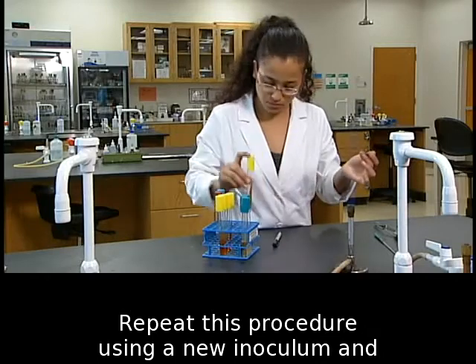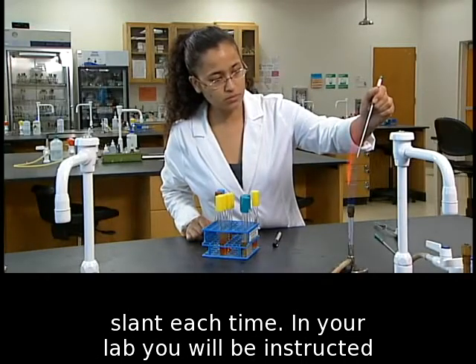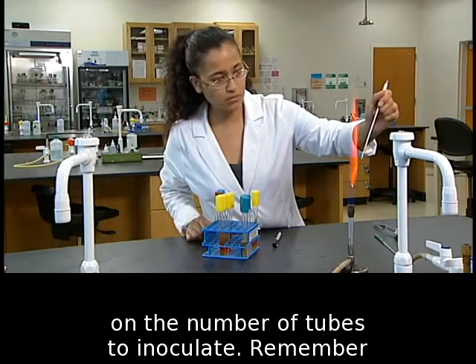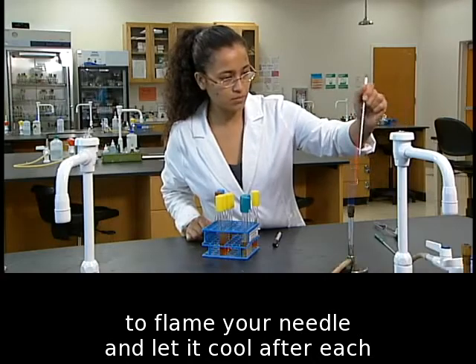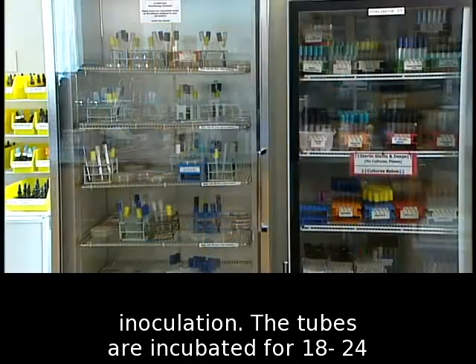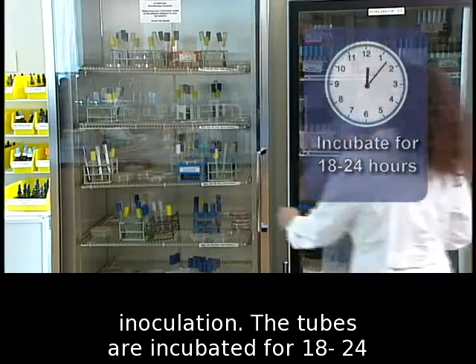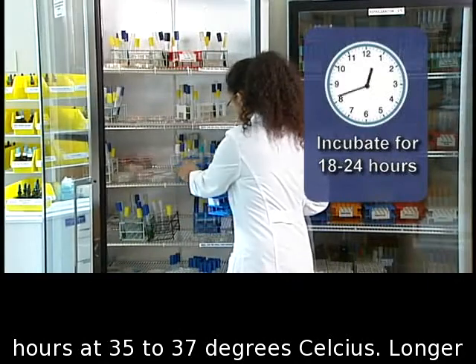Repeat this procedure using a new inoculum and slant each time. In your lab, you will be instructed on the number of tubes to inoculate. Remember to flame your needle and let it cool after each inoculation. The tubes are incubated for 18 to 24 hours at 35 to 37 degrees Celsius.